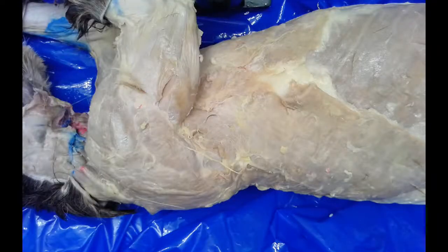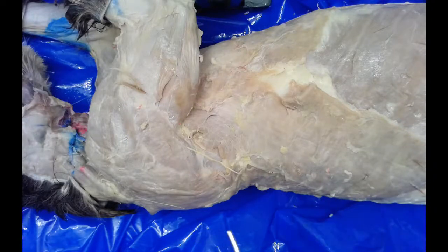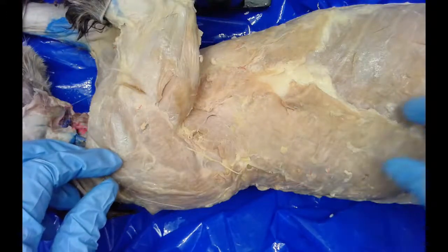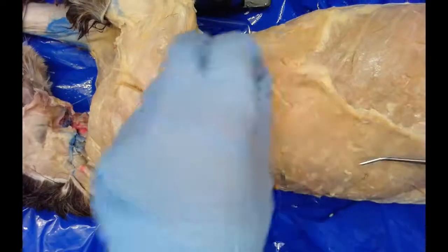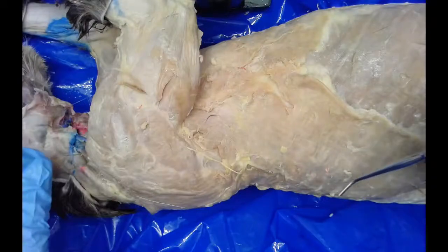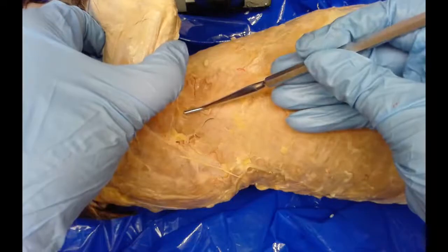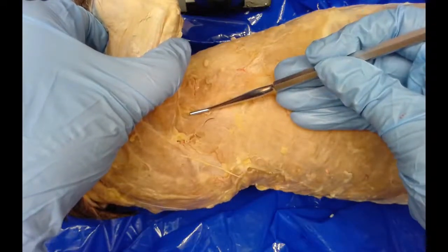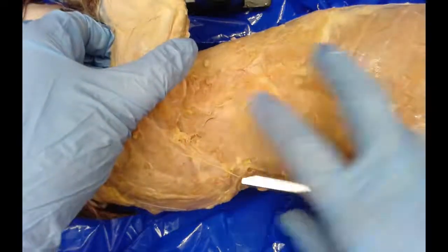We've flipped our cat over on its side to see the muscles on the back and shoulder region. There's one big, huge flap of a muscle here — with a lot of fat underneath — called the latissimus dorsi. It connects to the cat's armpit region and allows rotation of the front limb. It is also a powerful rotator of the trunk.